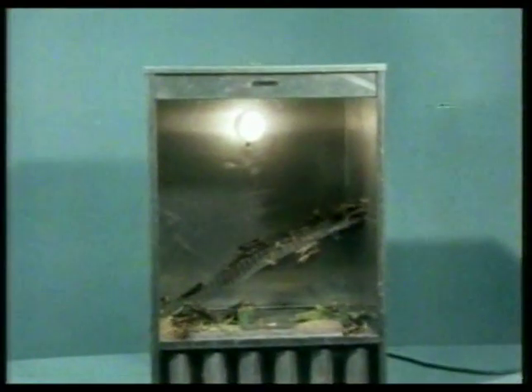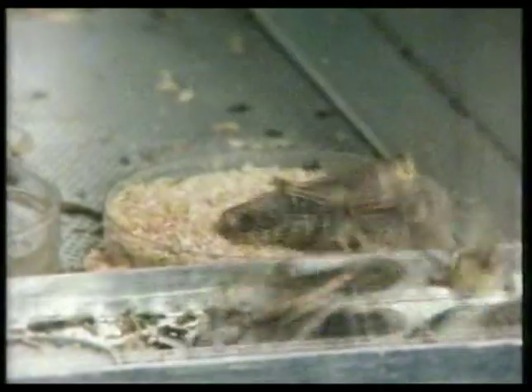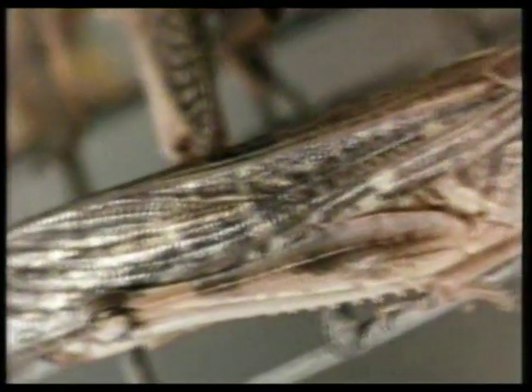We're going to examine part of the nervous system of the locust, and try to find out how the patterns of certain nerve impulses are related to the insect's behaviour when threatened by a possible predator. It leaps for safety when stimulated by sudden movements in its vicinity. We shall examine the impulses which pass along a chain of axons leading from the locust's brain to muscles in its jumping legs.